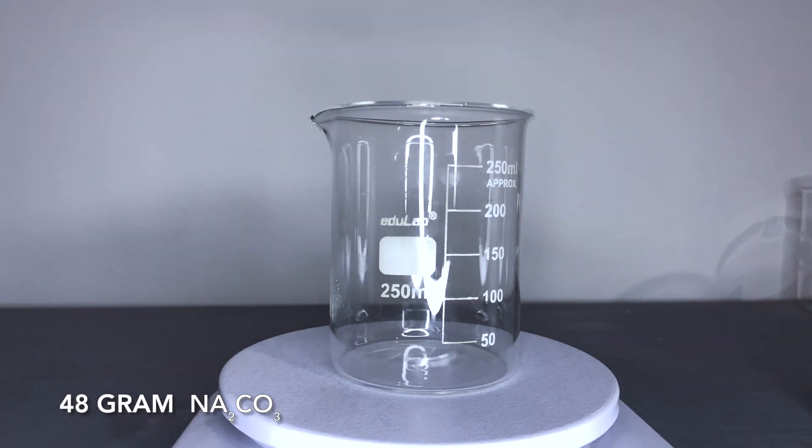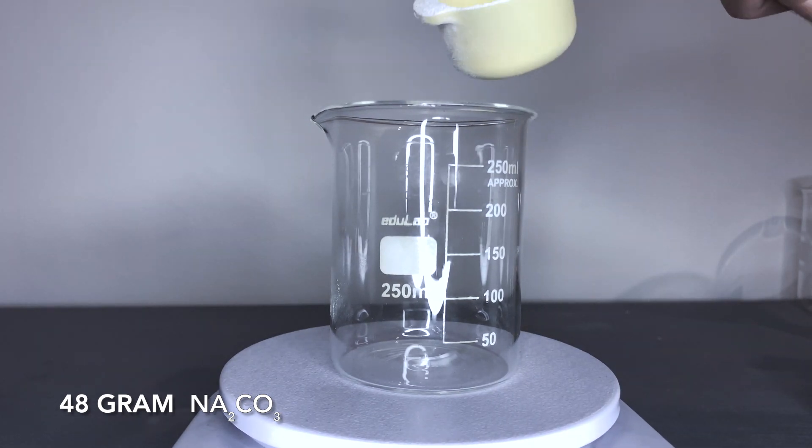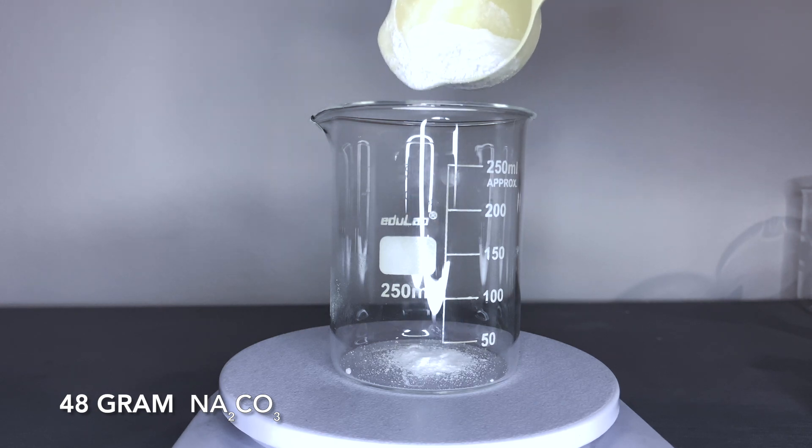Now, I am gonna prepare second solution, sodium carbonate salt. For that solution, I need 48 gram sodium carbonate salt.